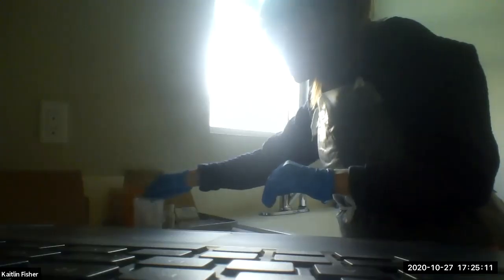Okay. So from there, that's all the safety and setup. Please go ahead and read your background and procedure to get more information on the theory behind the lab, as well as the pre-lab questions will help you with that. And with that, happy experimenting and good luck.